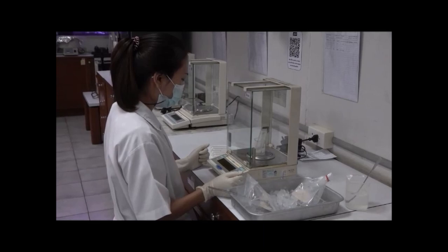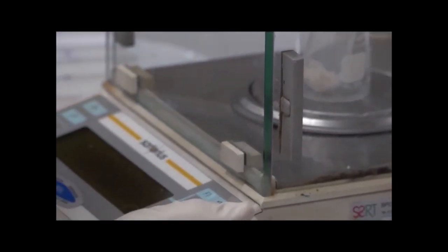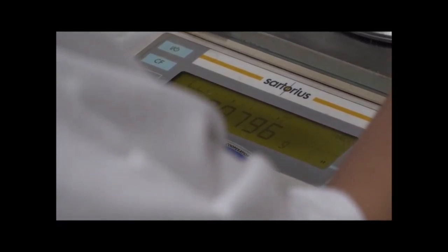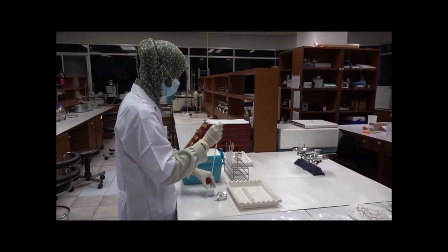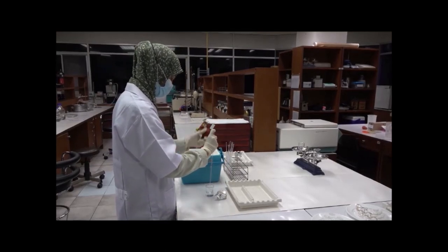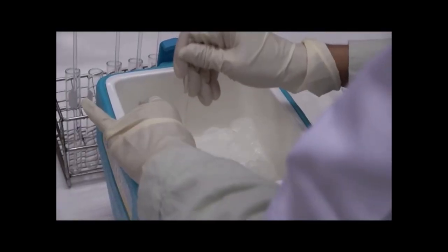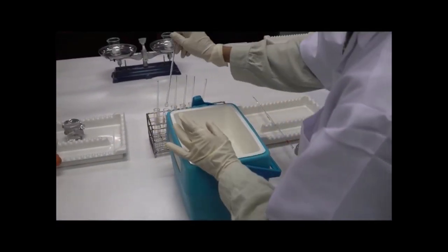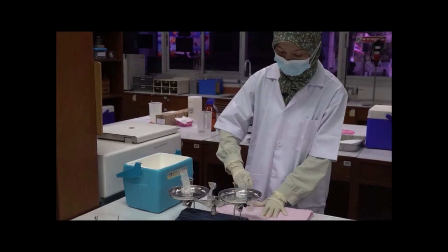Let's start with sample extraction. Weigh 1g of fish tissue. Add 2ml of 10% perchloric acid and grind until homogeneous. Balance with 4ml of 10% perchloric acid and grind once more.